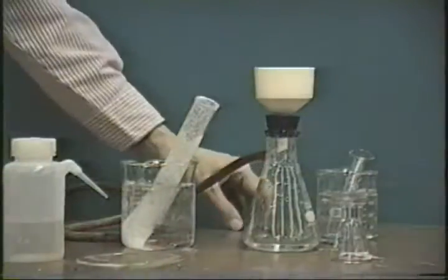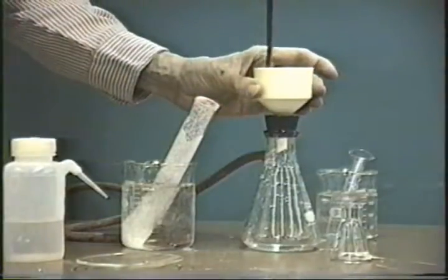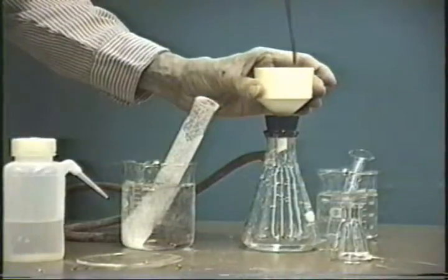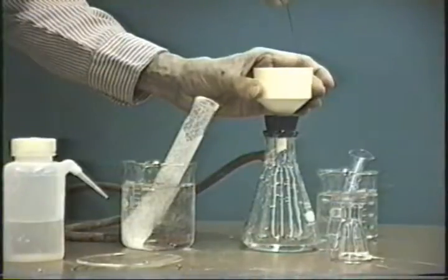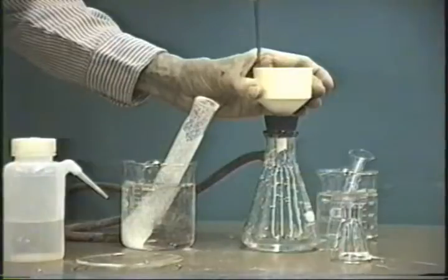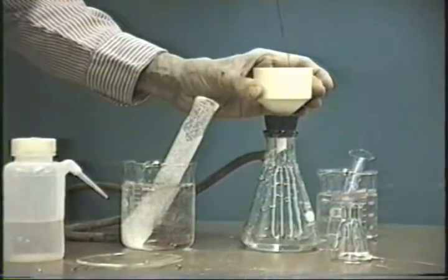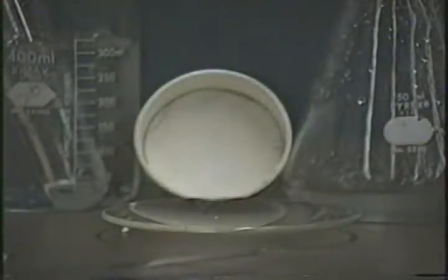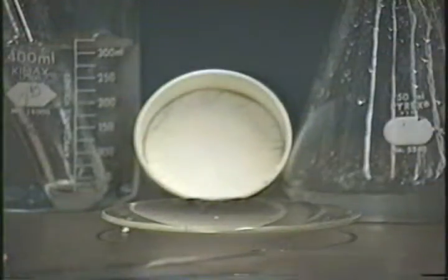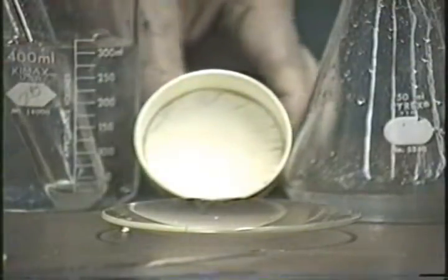Now a brief note on filtering. When the suction is complete, if we hear a hissing noise like you're hearing now, I'll go around the edges of the Buchner funnel, pushing down the filter paper to make sure that it is in place. After drying under suction for about 5 minutes, you're ready to take your sodium bicarbonate and put it on a watch glass to dry till next week.